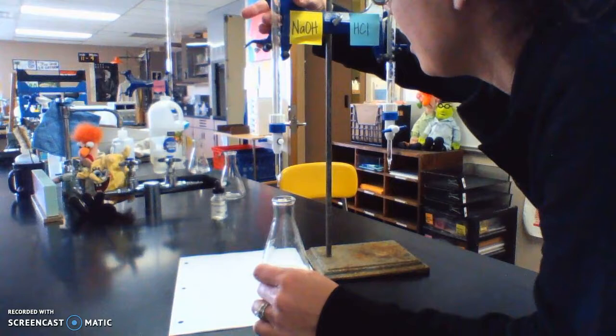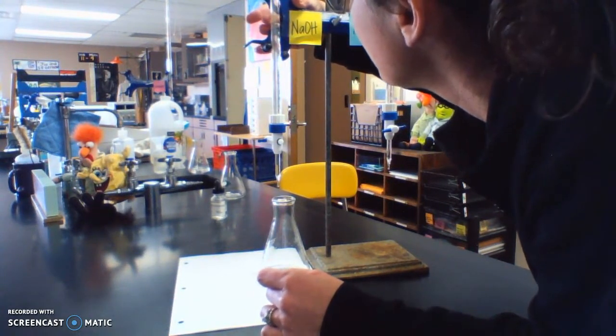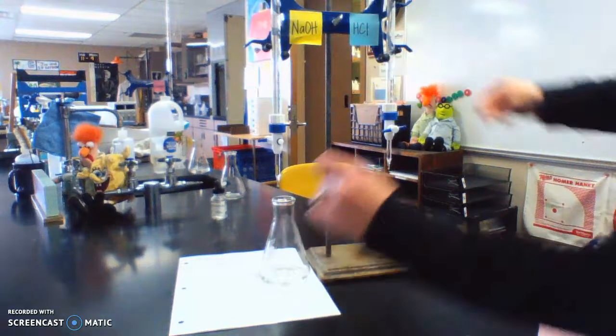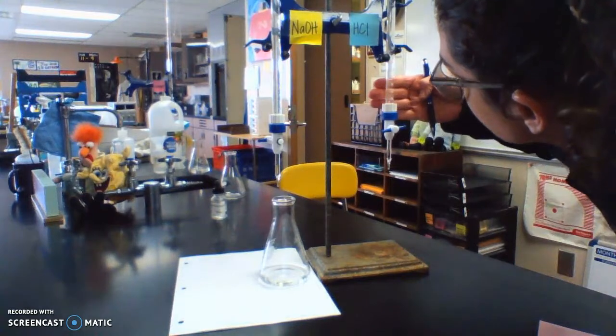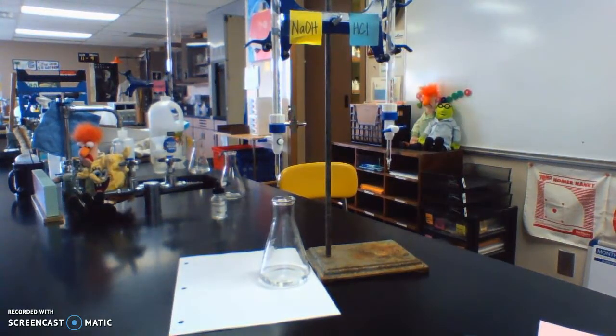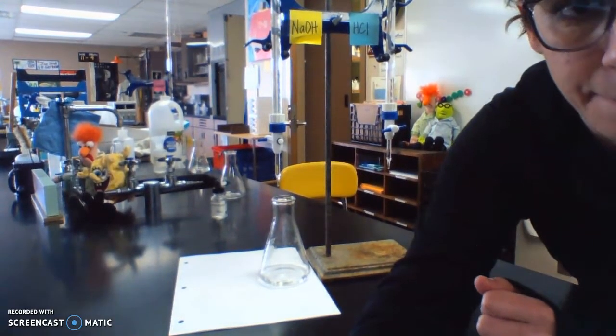And my base end is 37, let's say 59. So base 37.59. And I said 47 point, I think I said 23. All right, now I'm going to do one more trial, but I'll fill these both up before we do that.